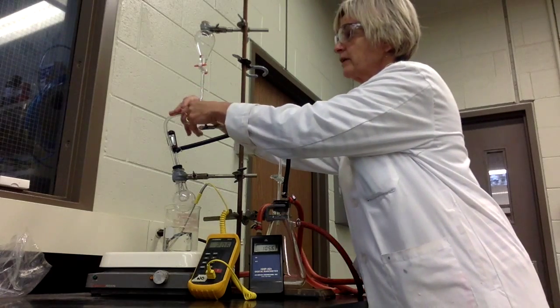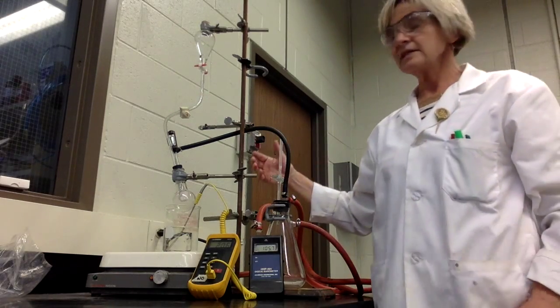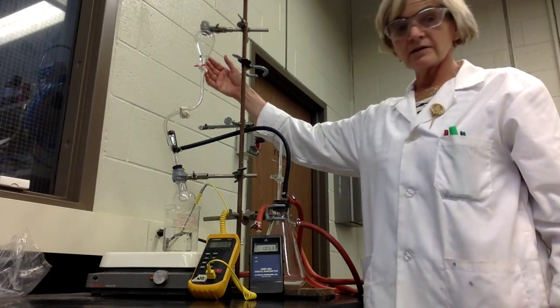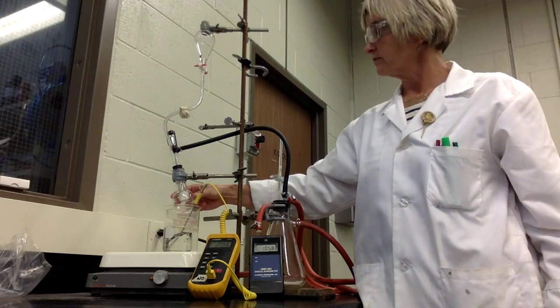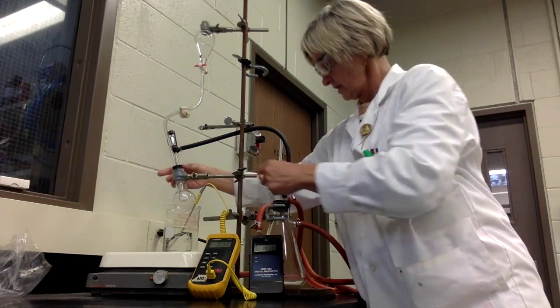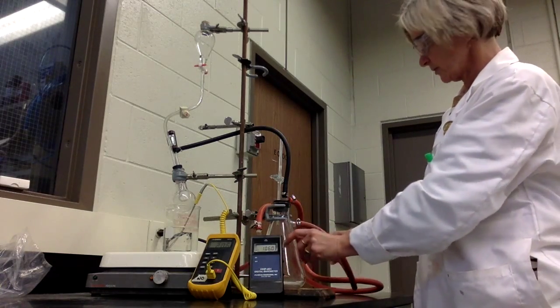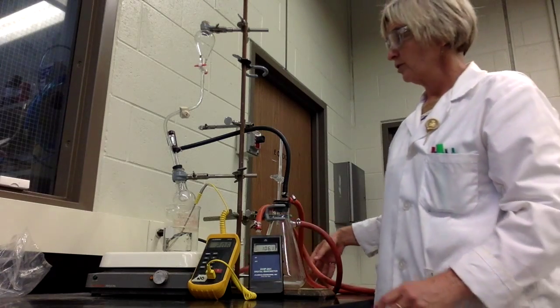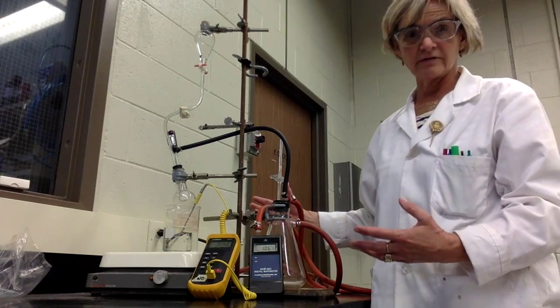We also have a pinch valve. At this point, it's a good idea to close that as well. This needs to be an isolated system. That means that the methanol is ultimately going to be delivered into this round bottom flask. You close this pinch valve, and on the far end of the system here, we've got an evacuation chamber. We'll close this pinch valve. We'll have a closed system, so it won't be impacted by the surrounding environment.